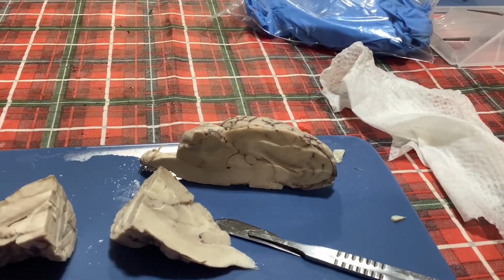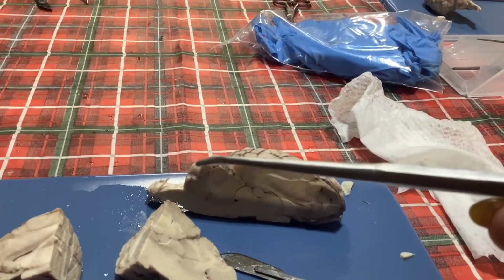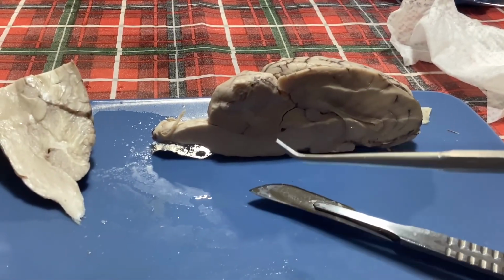Our arachnoid, pia, and dura mater are supposed to be on the outer layer of our brain, surrounding the entire thing, but we do not have that represented in here. It's supposed to be stacked above the brain. Okay, next we have the cerebellum that's going to be located right here. Next we have our cerebral aqueduct, which is going to be right here under the cerebellum.